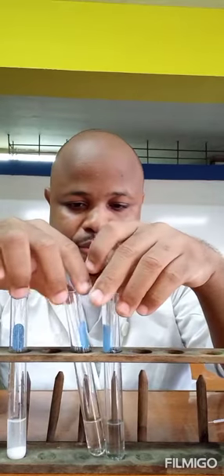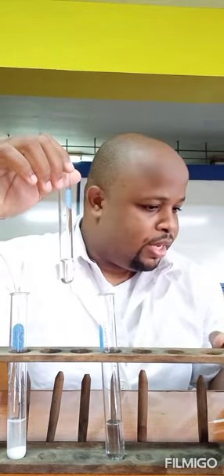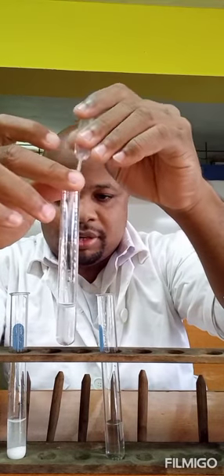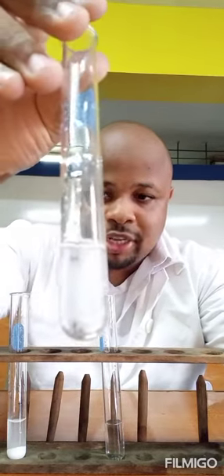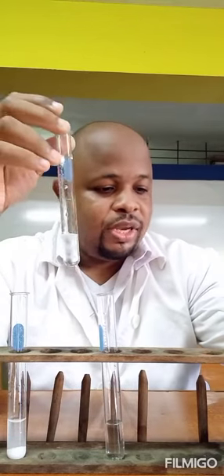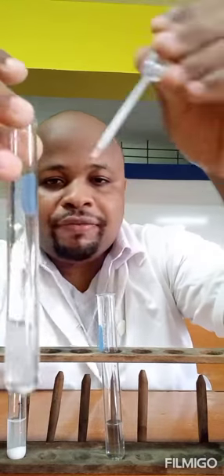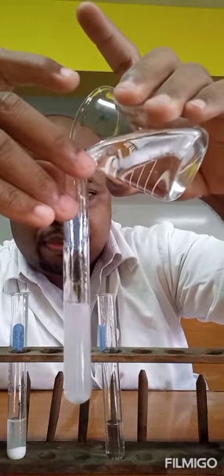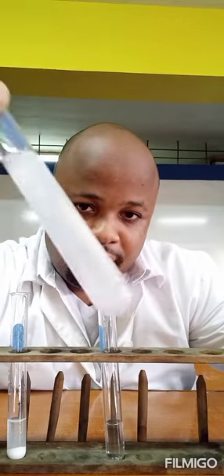So same thing again for cation B now. This is solution B. I'm going to add a few drops of sodium hydroxide. There's the precipitate — it's not as bright as the one before but we get the precipitate. Now let's add it in excess and see if it dissolves. It is not dissolving. So which ion can form a white precipitate with sodium hydroxide and does not dissolve when you add it in excess?